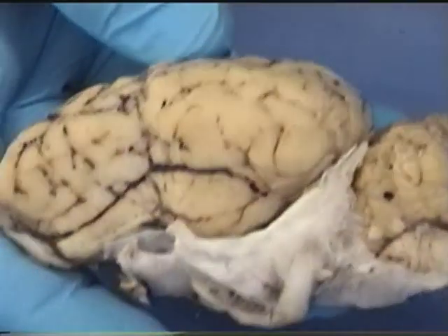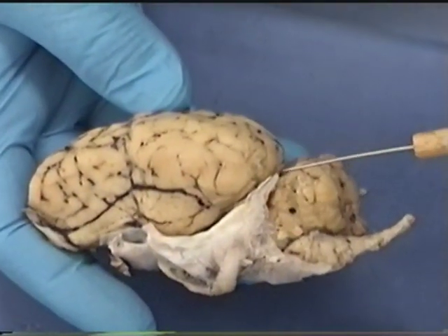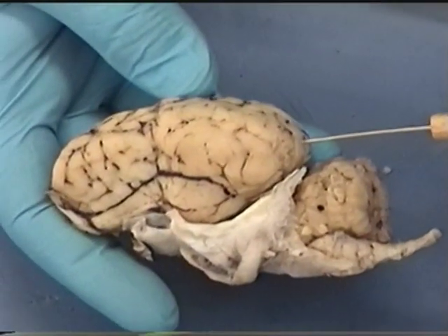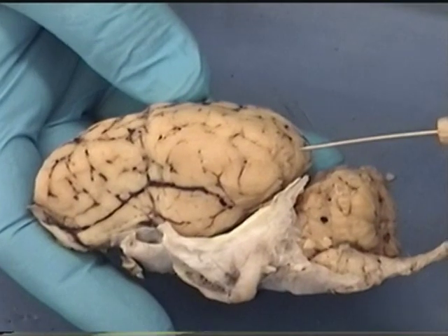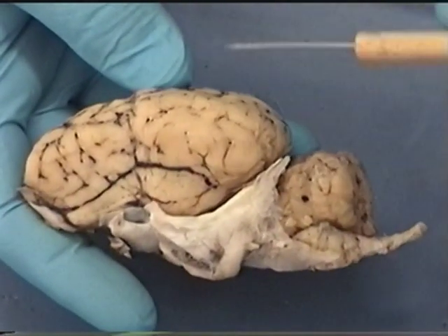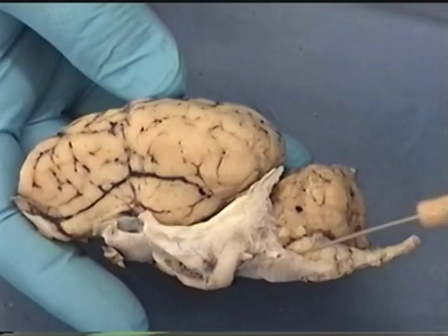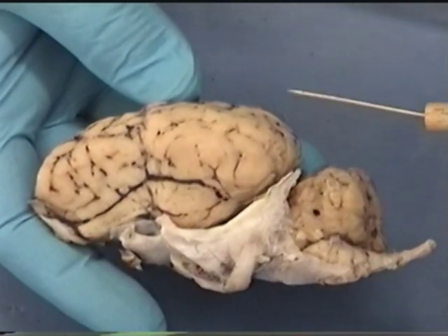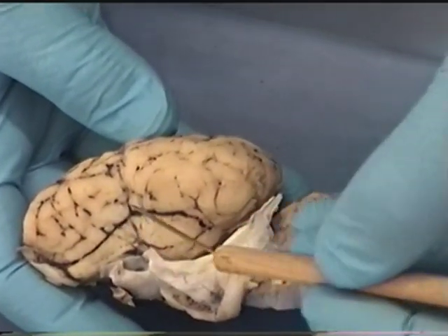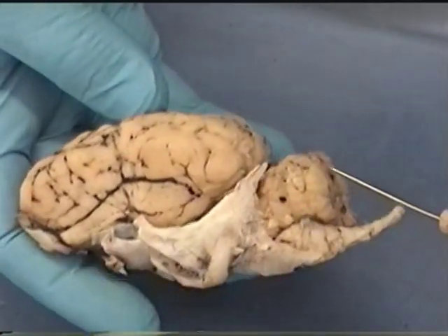Next we're going to go through the structures on the sheep brain that you are required to know. Note that on your lab there are parentheses with asterisks, and the asterisks tell you that you should also be able to find it on the sheep brain. Previously we did the meninges, so we're going to take a tour of the external anatomy of the brain and then the internal anatomy.